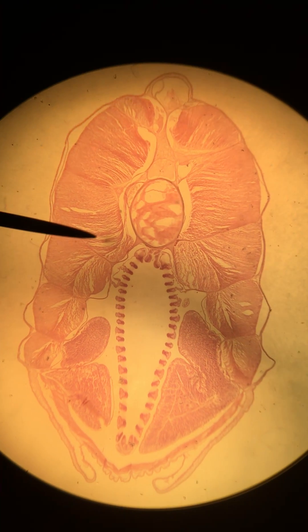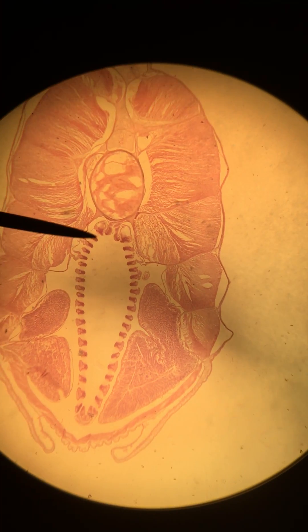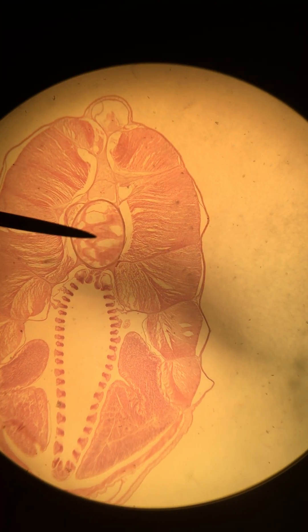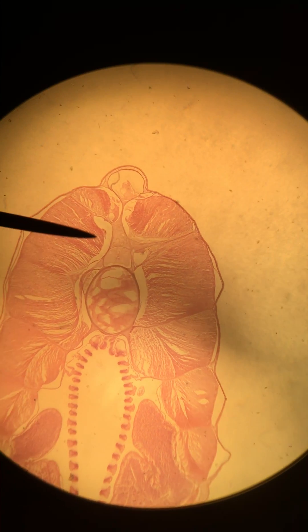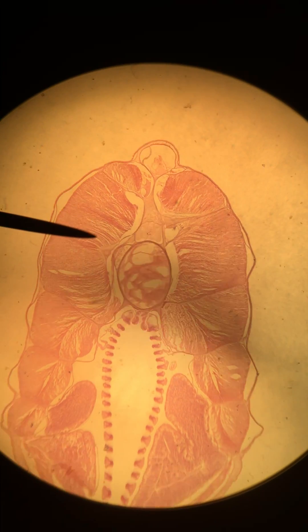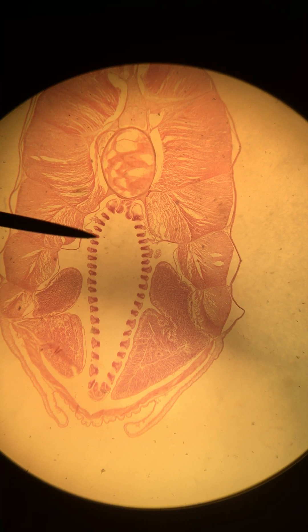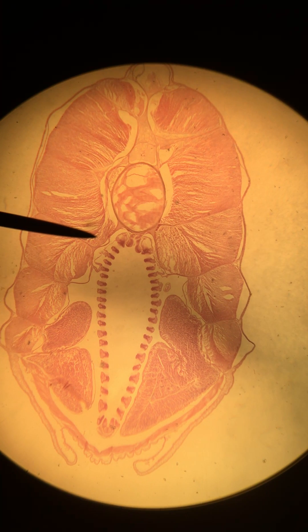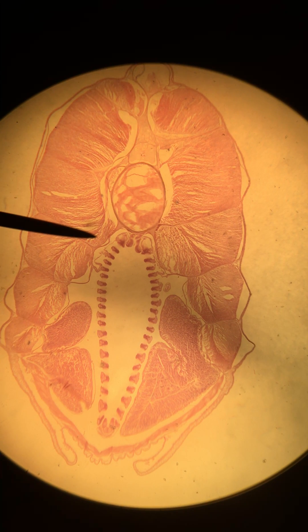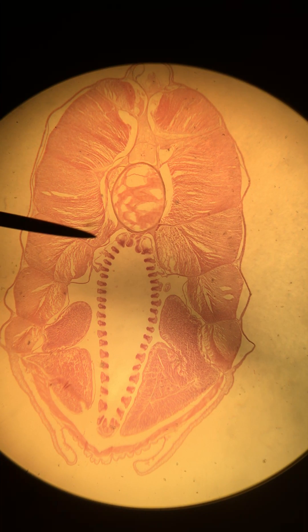If you want to be sure, you can always zoom in, but this is the male and the previous one was a female. Everything else looks pretty much the same at this section — we still have a notochord, nerve cord, myomeres, and myosepta. Be sure to reference the last video for those details. That's it for the male.